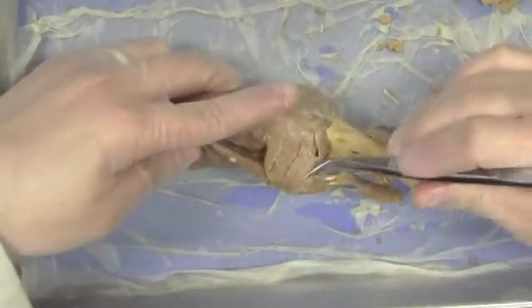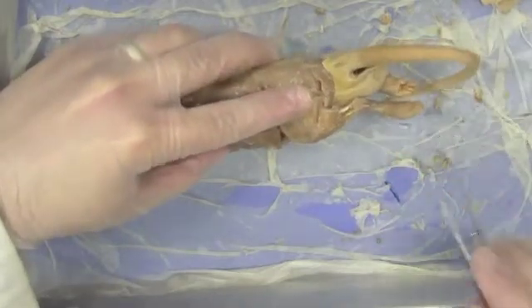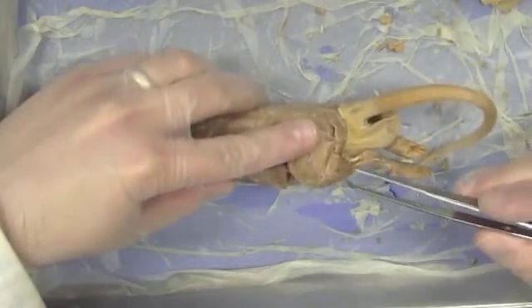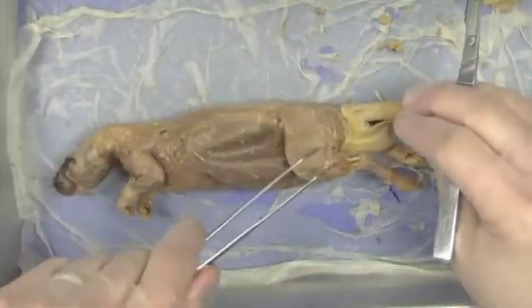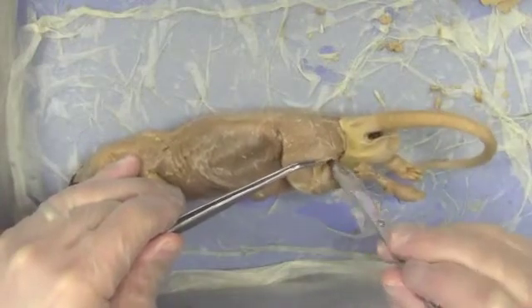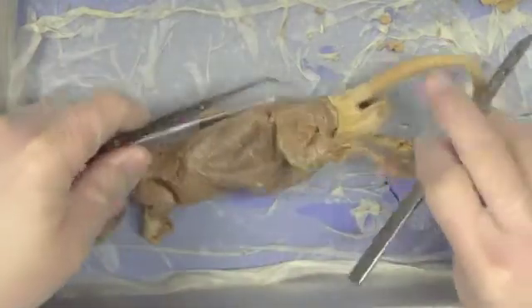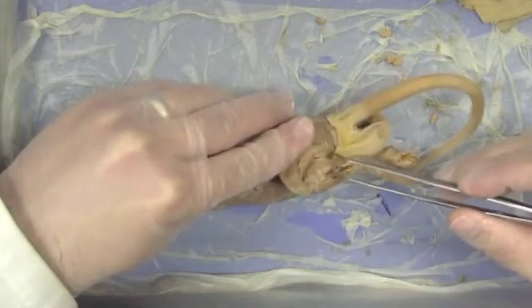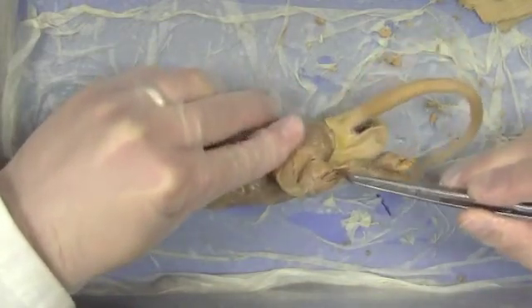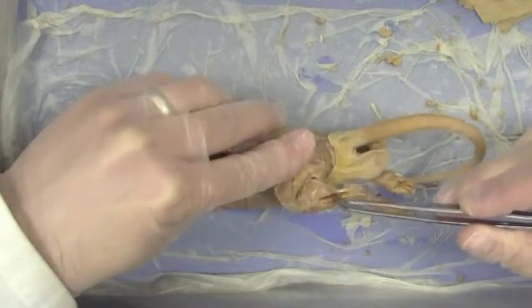Now I'm going to reflect the biceps femoris — pull it back just a little bit — and that's going to allow me to see the musculature that makes up the calf. The largest muscle in the lower leg is the gastrocnemius, a big beefy muscle just like it is on the human. I'll go ahead and cut that biceps muscle and get it out of the way. Underneath the gastrocnemius is a much thinner muscle called the soleus.